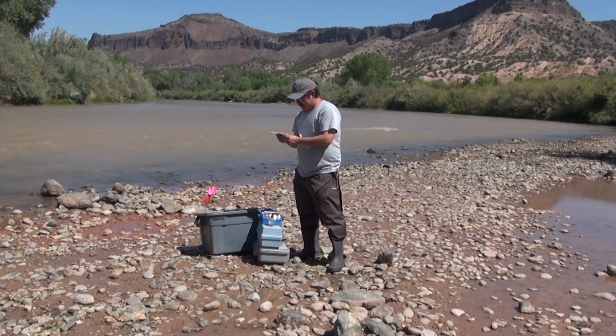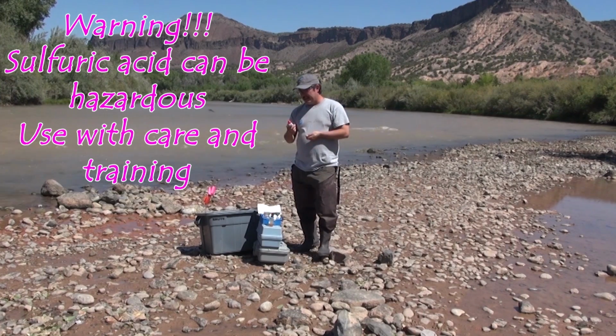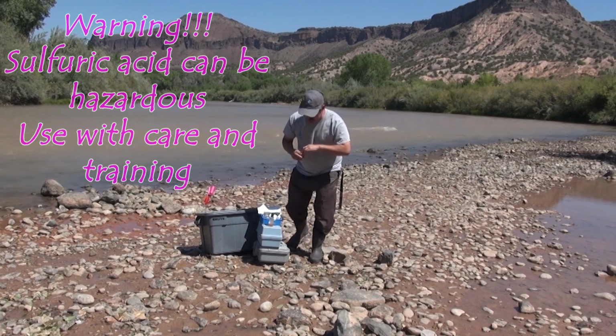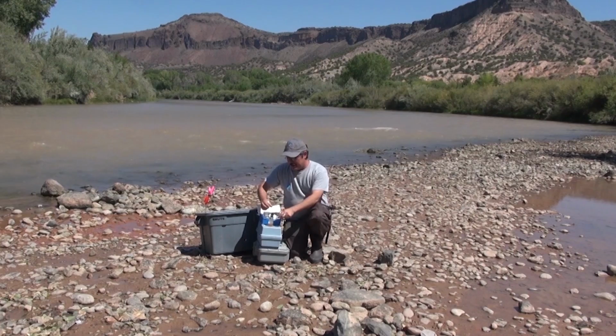So according to this, I will now place in 8 drops of sulfuric acid. This is probably the most hazardous chemical that we have here, but it's not a very strong acid. It's not going to burn your skin or hurt you. The main issue is that it shouldn't be ingested. Since we're only using 8 drops of it, it limits the hazard that we have. Again, you want to make sure that we're being careful when we utilize this.